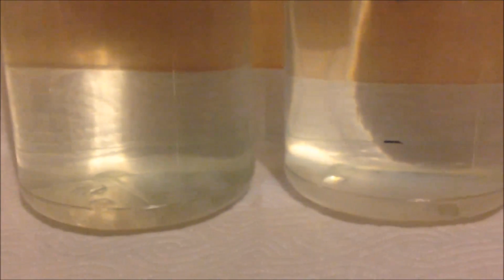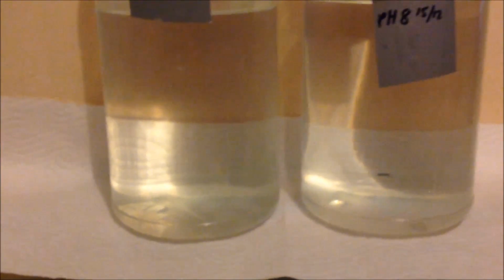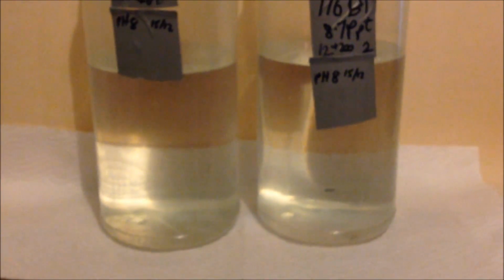And you can see it a bit clearer there in sample B. So I think the goal will be to bring that up to pH 10.7. Now we shouldn't have any magnesium hydroxide to speak of in this sample, because that's what we left behind when we racked this off. We're just dealing with a solution and any dissolved supposed M state, so that's what we'll do.